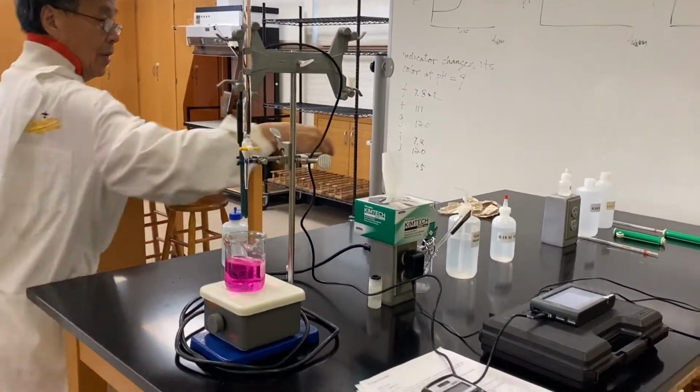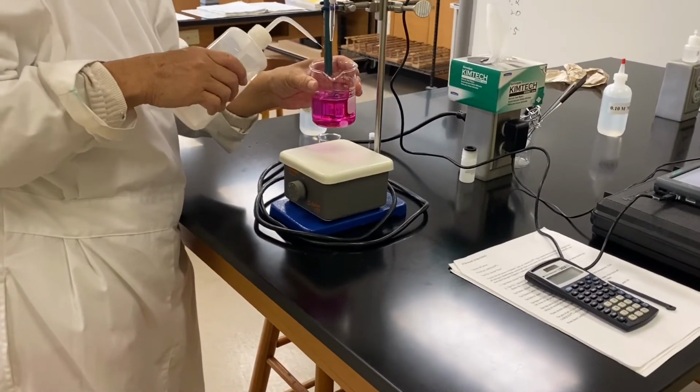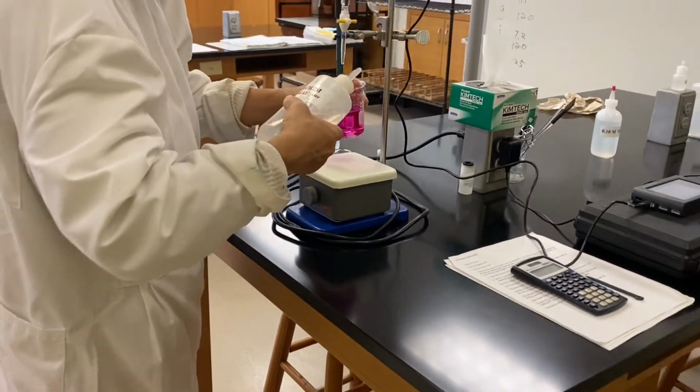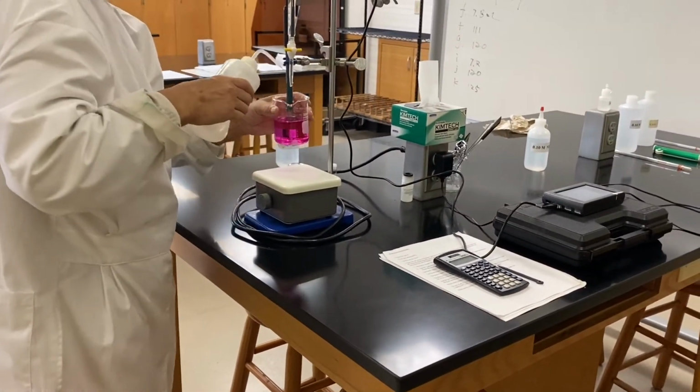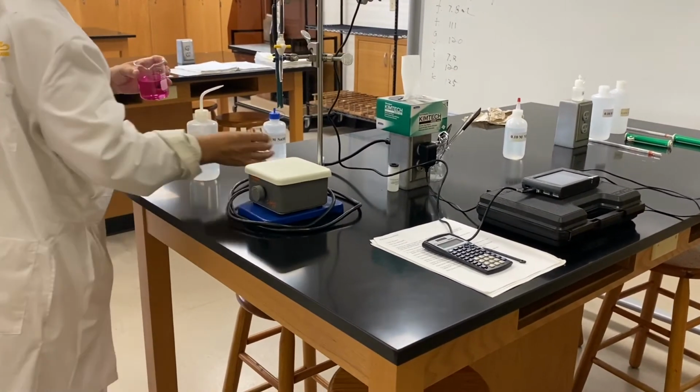Now, because we're going to switch the system, we have to keep the integrity of the solution, and then we wash, rinse our system, and clean.